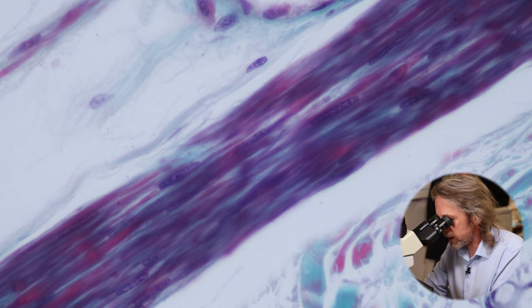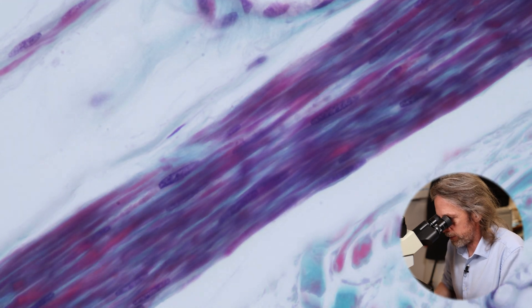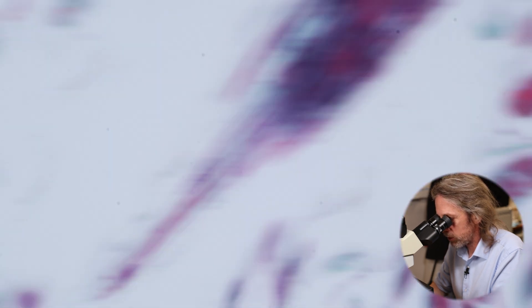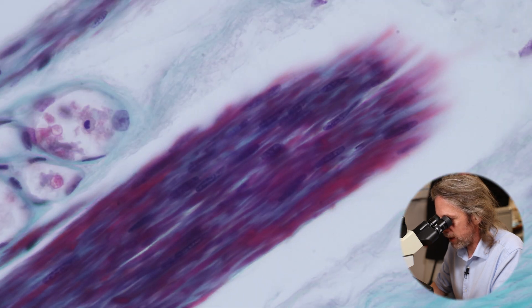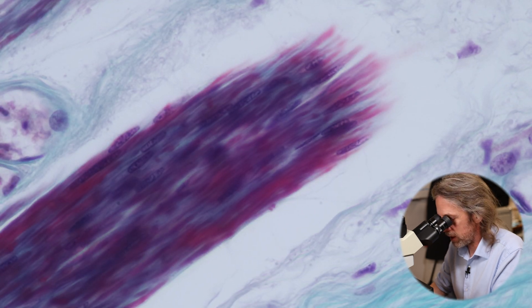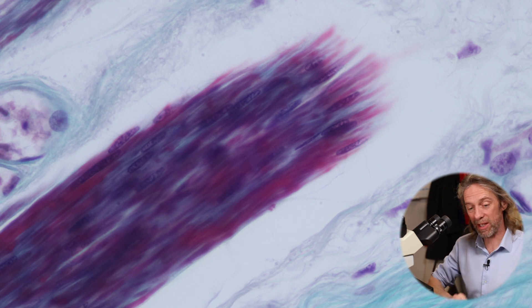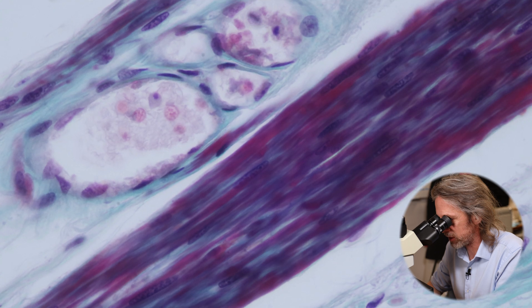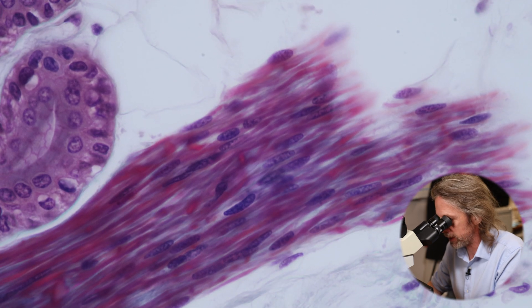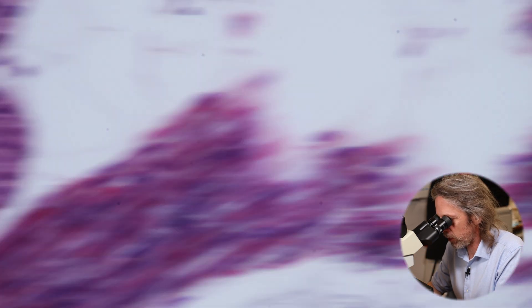This is a slightly differently stained section - the green is connective tissue, so you can see all the connective tissue helping hold the smooth muscle together. You can see some cigar-shaped nuclei and a lot of red, which is the muscle. We can just about see some individual smooth muscle cells here. It's like a rod of smooth muscle being cut through - we only see part of it because of the plane of section. Cutting thin sections means we observe the body in two dimensions.